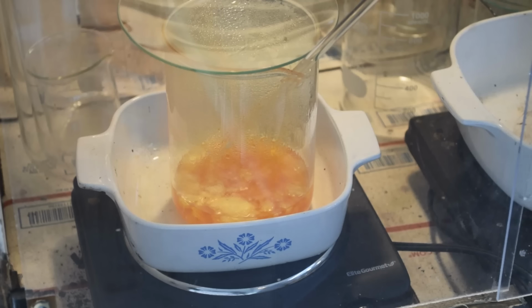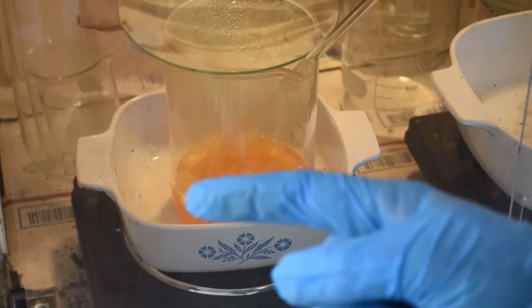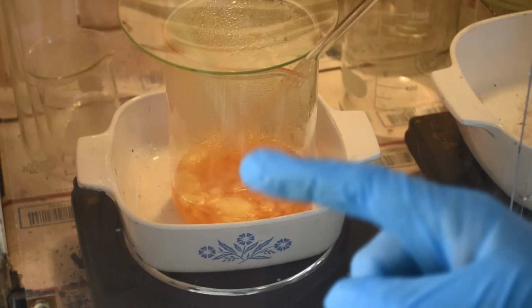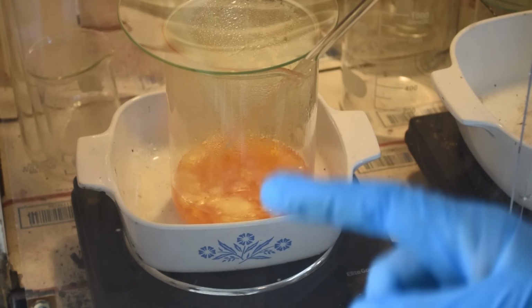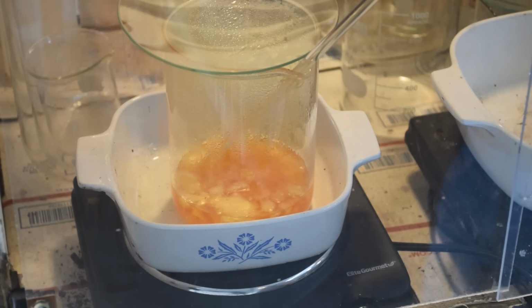Okay, so we got two problems here. Number one, the leach isn't taking all the gold off, although that may be a matter of me not getting the parts clean enough before putting them through the leach. And number two, not all the gold is precipitating out of the leach. That's important to know. And I've got to figure out how to make the rest of the gold precipitate out. Got lots of thinking to do and probably a lot of behind-the-scenes experimenting. Owltech, if you're watching, that's important to know. Anthony Thomas, if you're watching, this is an important revelation.